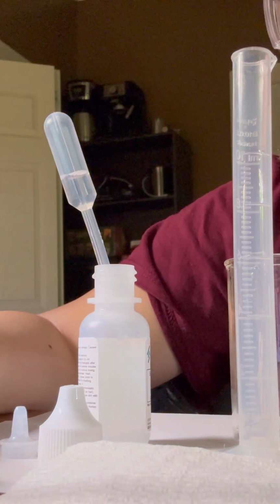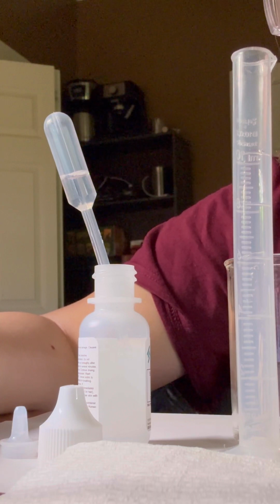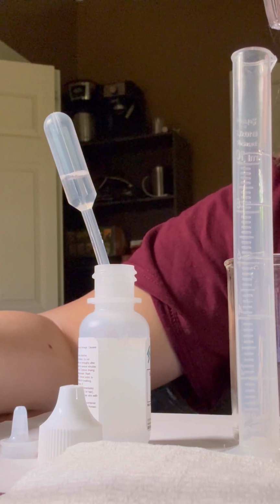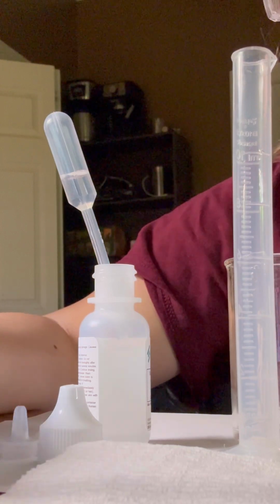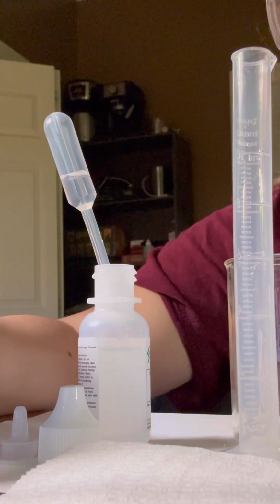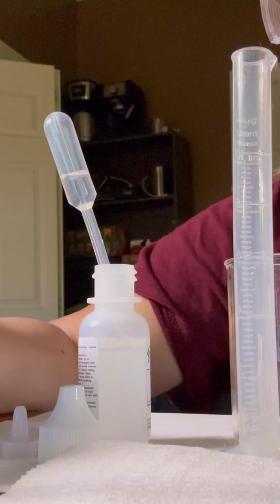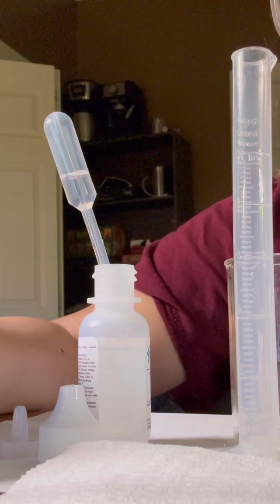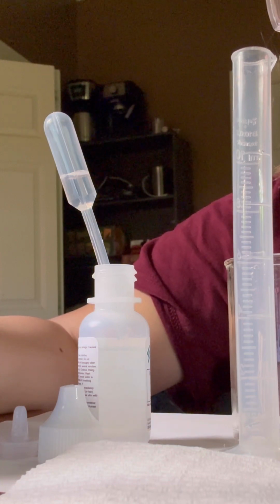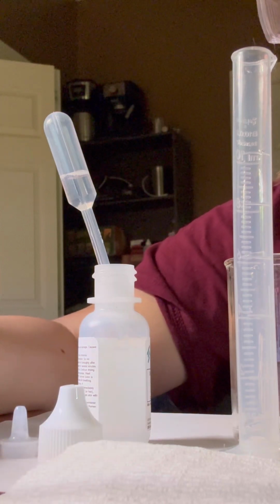And now we add from the pipette into the beaker containing the 4 milliliters of unknown weak acid, 1 drop at a time, swirling the solution in the beaker after each drop, until the color changes to a pale pink color for at least 5 seconds. We count each drop of sodium hydroxide added to the beaker, so we will know exactly how many drops of sodium hydroxide were required to cause the solution to change from clear and colorless to the pale pink color.